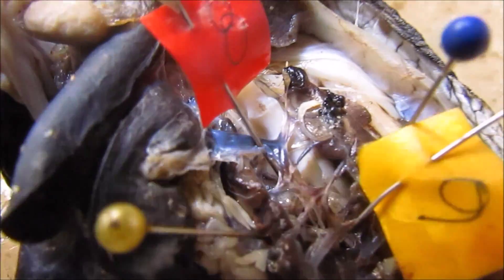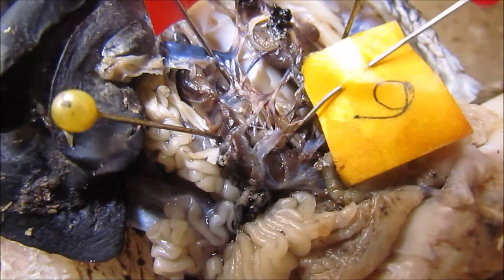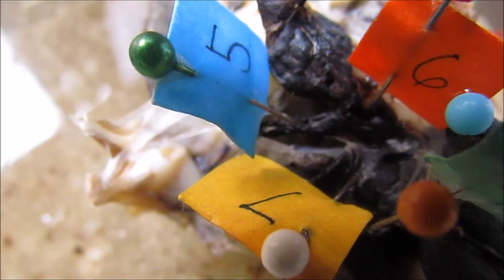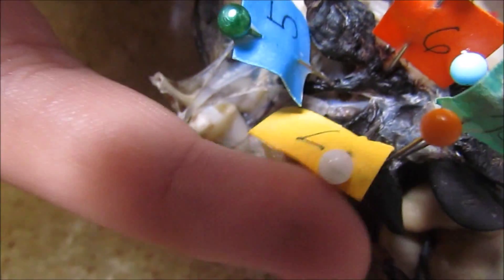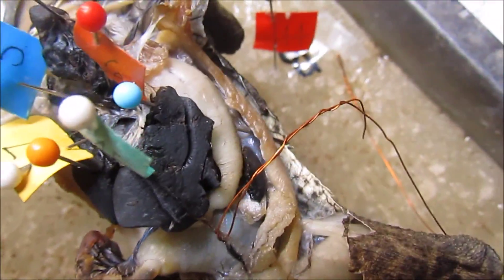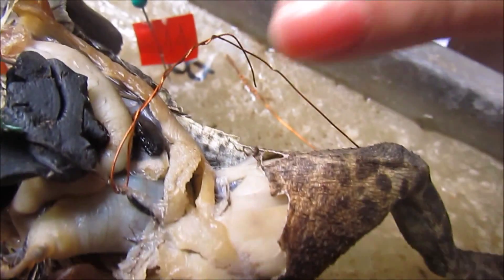Number eight is the postcaval vein. Number nine is the renal vein. Number five is the precaval. Then next is number six — the postcaval. Number seven is the hepatic vein. Then this one here is the hepatic portal vein, number 14. And this line here is the ventral abdominal vein.